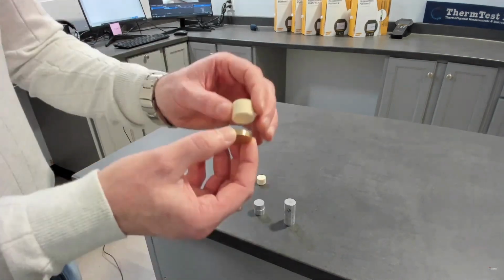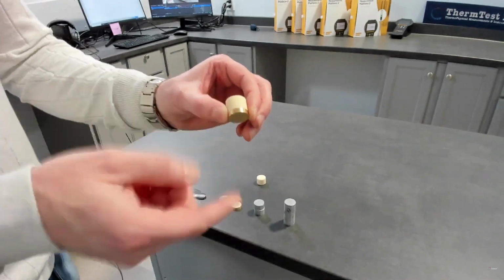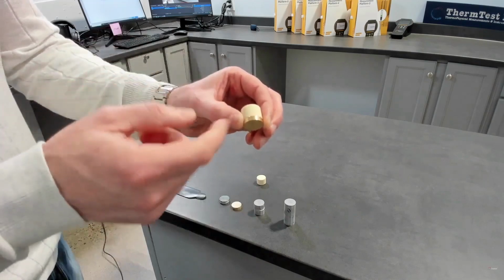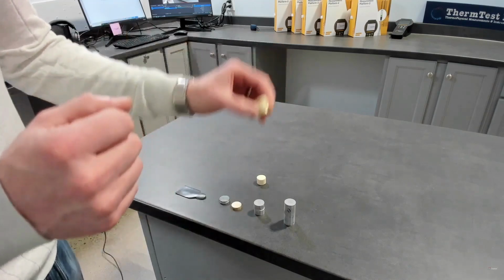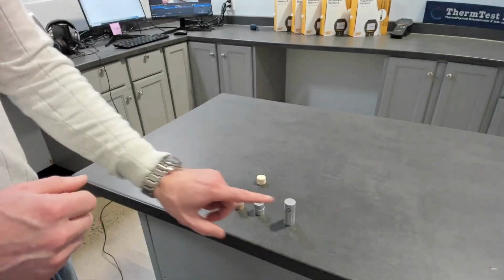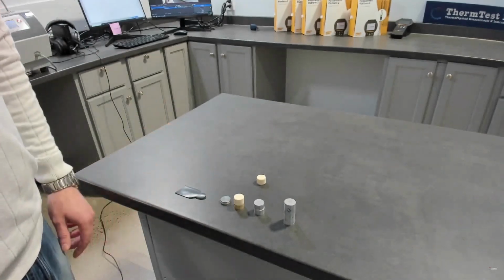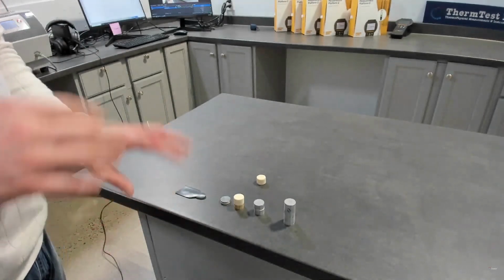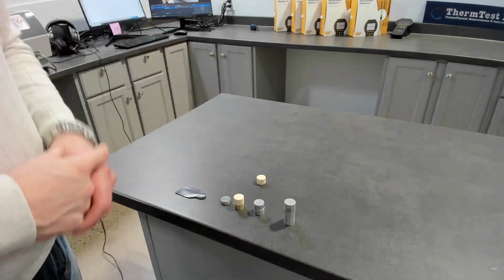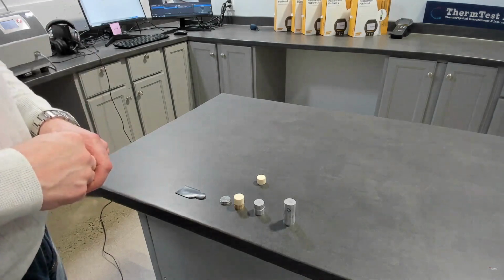Well, when you insulate it and you create a slab out of that, we know the boundary. Rather, you input the thickness, and now we have a dimension. So we get all three properties. It allows us a great deal more flexibility on sample height, and another big advantage is you don't need the specific heat input. So it's really a wonderful next step, the next generation of the one-dimensional module. We're going to show the physical setup, then go to the software and show you some data.